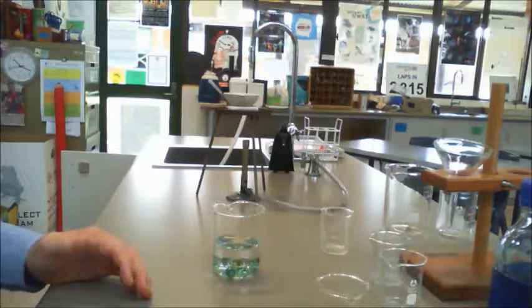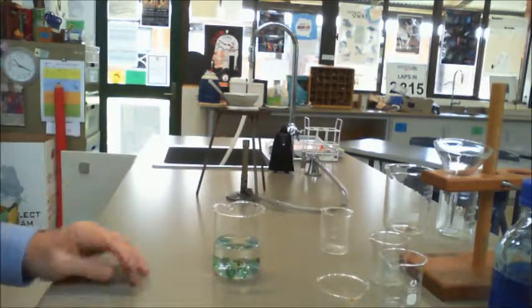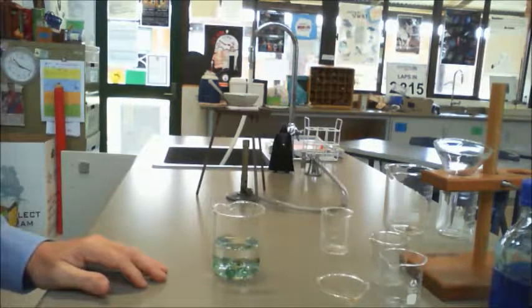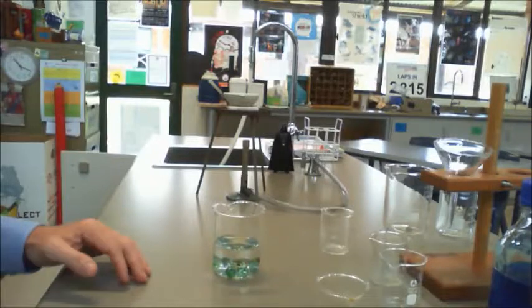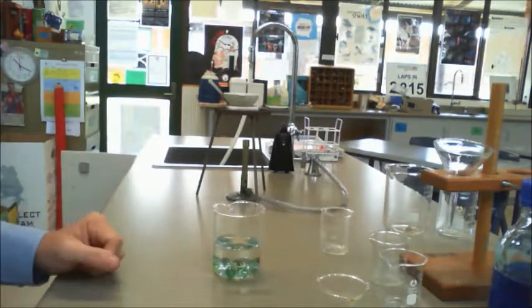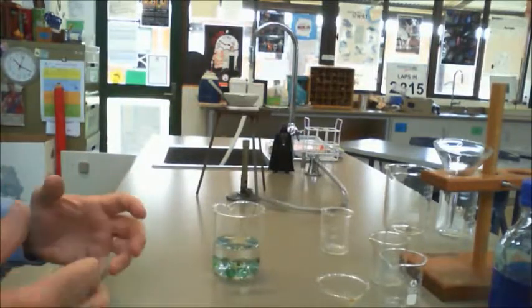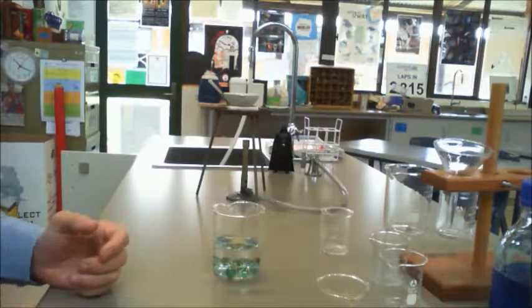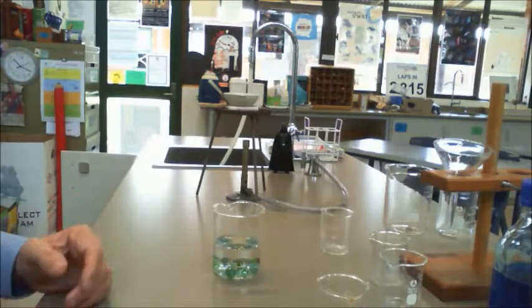Welcome, ladies and gentlemen, to Warwick Science's Year 7 filmed practicals on chemical science, and this one is going to be around the separation techniques of decantation and filtration. Now, we use decantation and filtration in separating insoluble substances. You can't filter and you can't decant a substance that dissolves in a solvent, so you can only do it for insolubles.